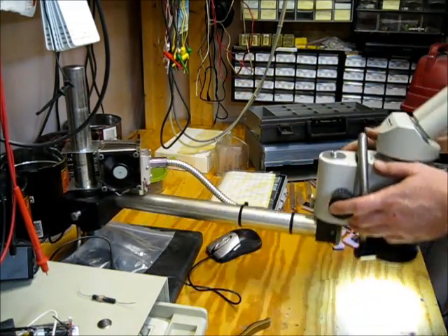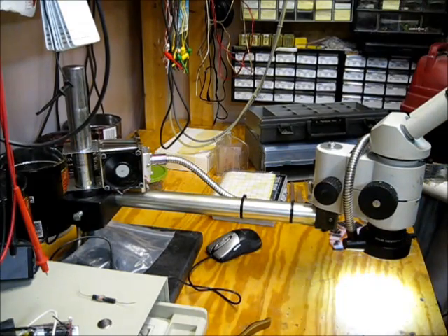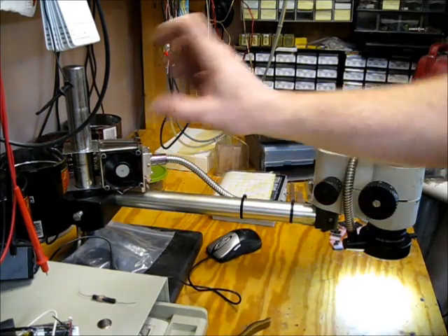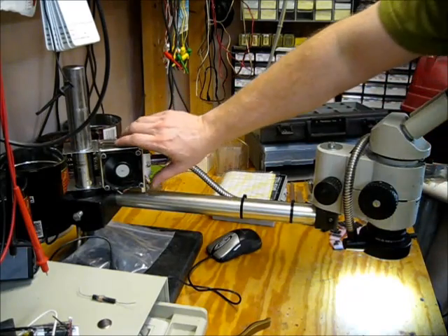Again, move it, flex it, focus. I'm going to call this project done, other than I want to find a finger guard for the fan. Again, it's an oddball size, so I'm hoping I can find the next normal size bigger and just re-drill the holes in it. I just haven't sat down and done that yet.